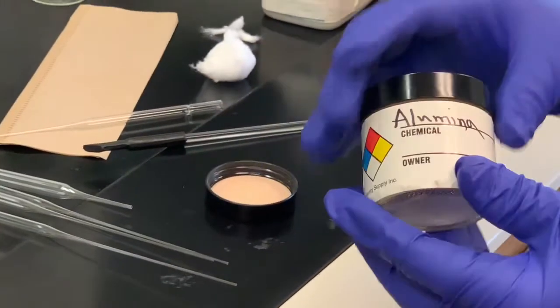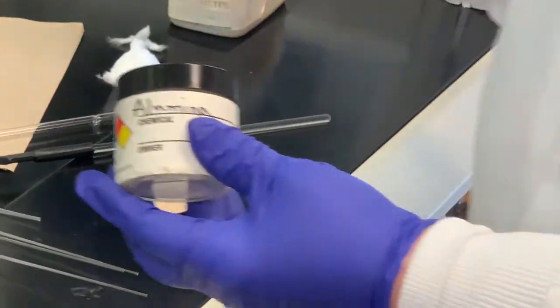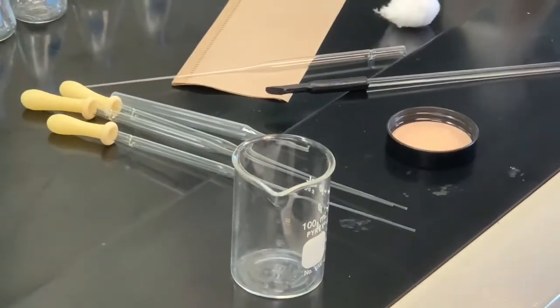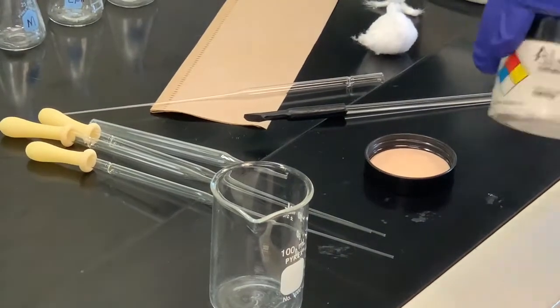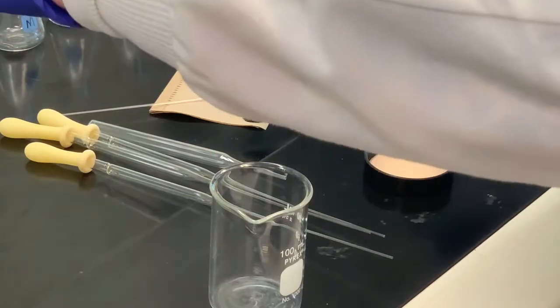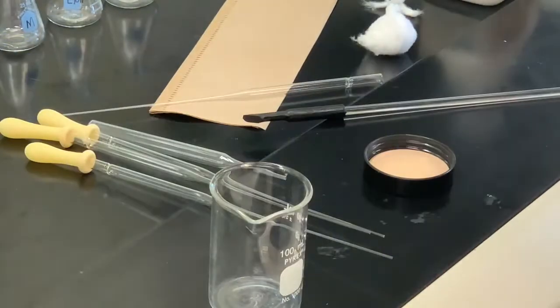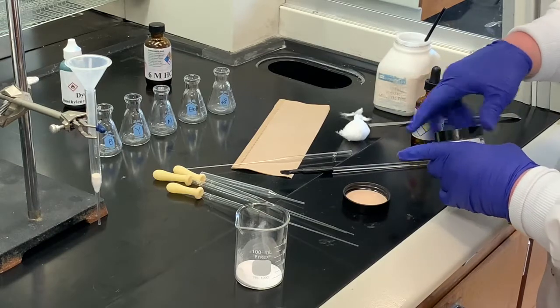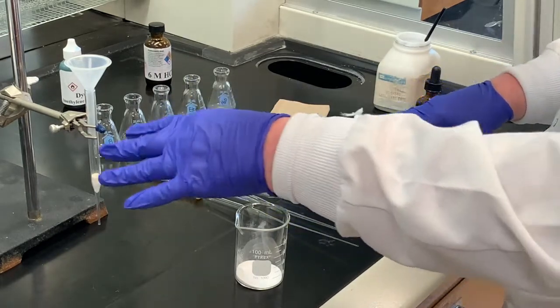I'm going to make a slurry of this. What I'm going to do is take some of this, put in a beaker, and then add some of my ethanol to that. And then once I do that, we'll stir it up. It'll be more like a slurry. We'll pour it in and then tap the sides too. I'm going to start with this much. I'm not quite sure how much will be needed to fill this up.